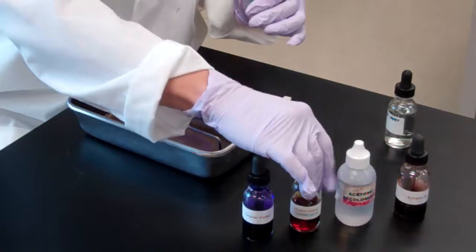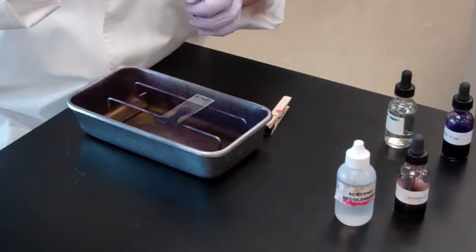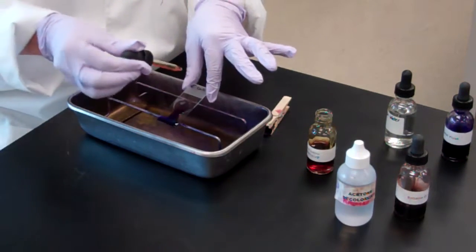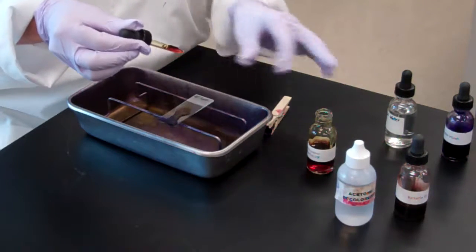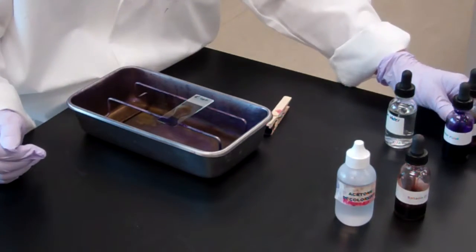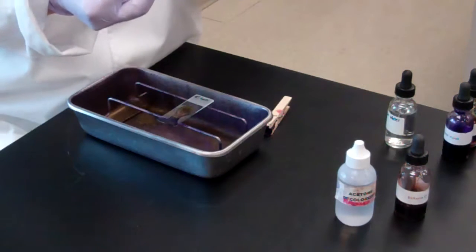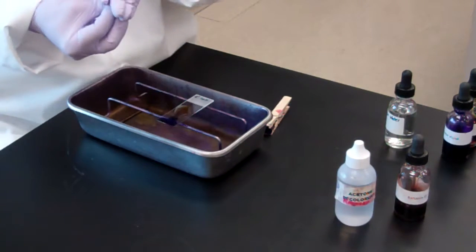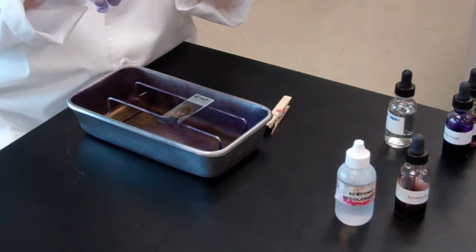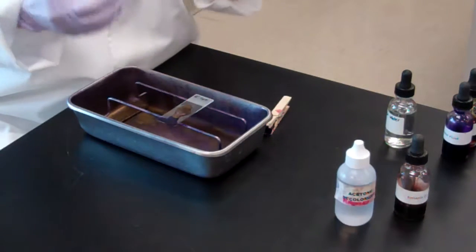The next reagent we're going to add is iodine. You're going to follow the same process: 1 or 2 drops, and that will sit for 1 minute. What the iodine acts like is what's known as a mordant. A mordant is going to allow that crystal violet that's been placed to directly adhere to the peptidoglycan. When iodine is added, whether it's gram-positive or gram-negative, the bacterium is going to appear this purple-like color. This sits for 1 minute.